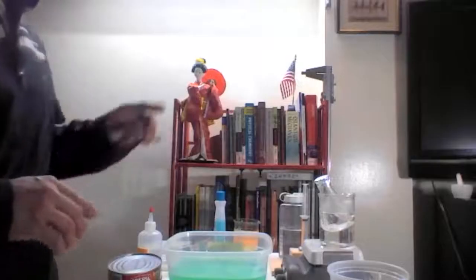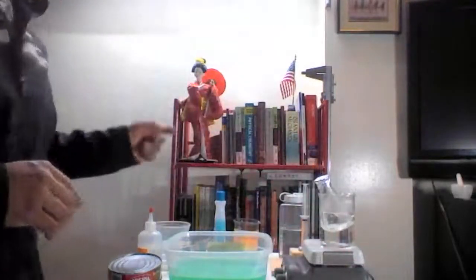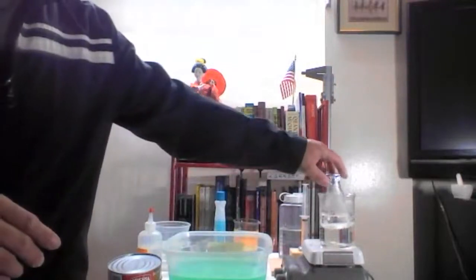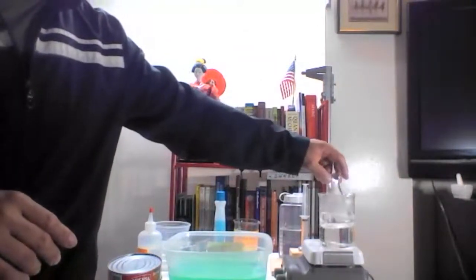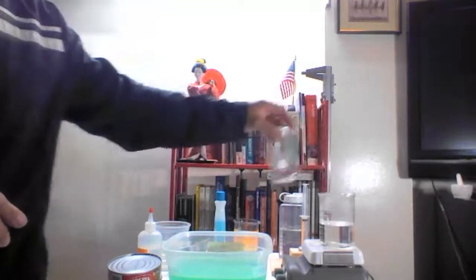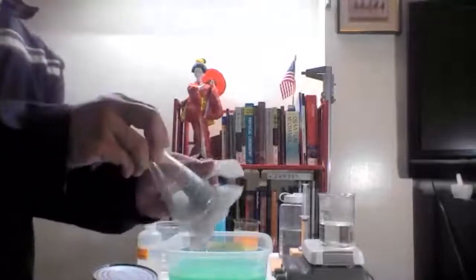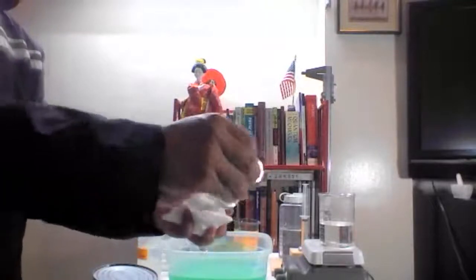Now all that we need is the Avogadro data. So we take out this. This is the idea. Right now, you have all of the molecules that can occupy the volume at that temperature and the barometric pressure this day. When you transfer this to the cold water bath, you dry the flask to make sure whatever you have here is only the material that condenses.